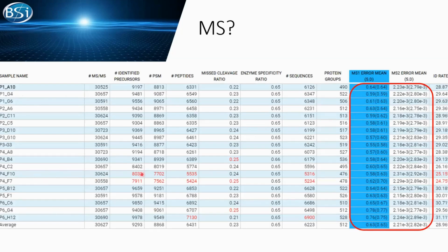We are seeing some low attributes in plate 4, but we all know this already. It's coming from the identified low precursor count that leads to a series of low numbers, for example, PSMs and peptides. We all know this already. That's okay, but what if the mass spec goes wrong? Could the mass spec cause this issue? We can see, okay, in our mass spec attributes, all our numbers are fairly consistent.